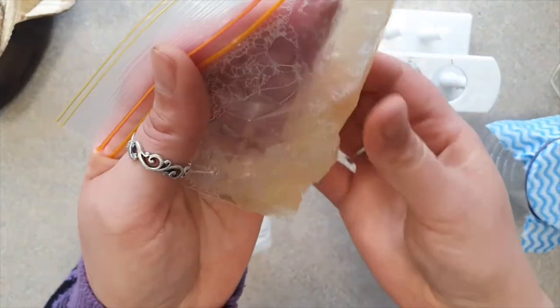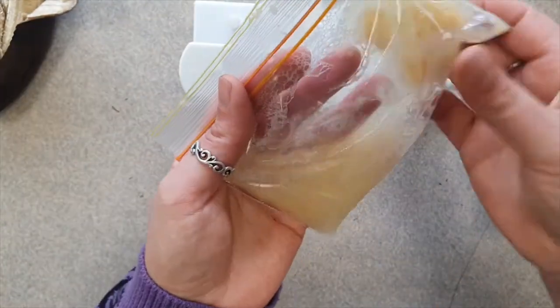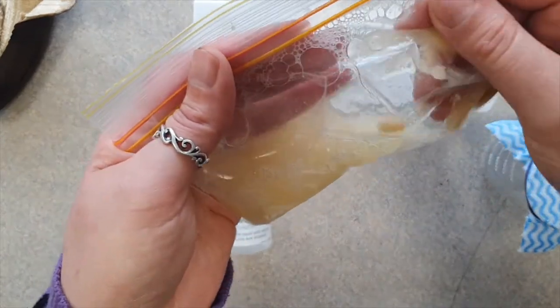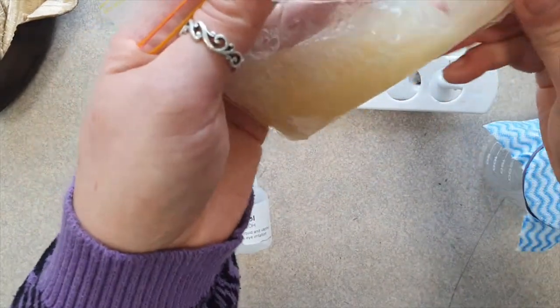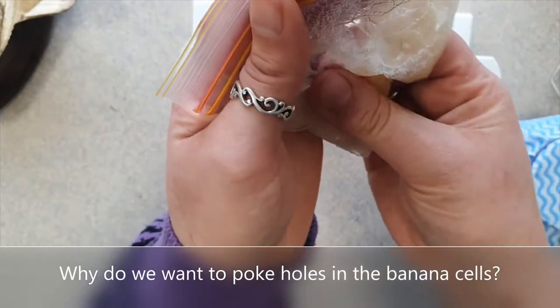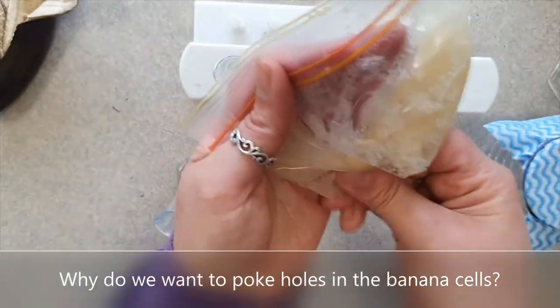So right now this soap is acting on the membrane of the cells in the banana, and it's poking holes in the membrane with the soap because the membrane is fat. Soap breaks up fat. We all know this. So that's what's happening right now.